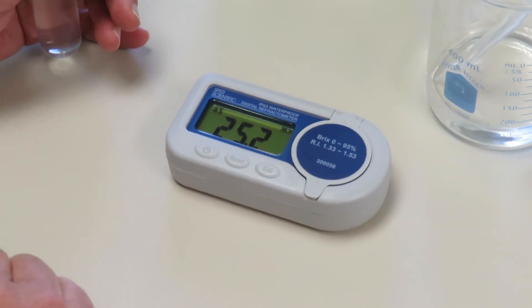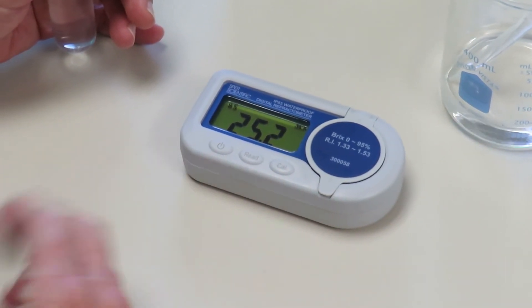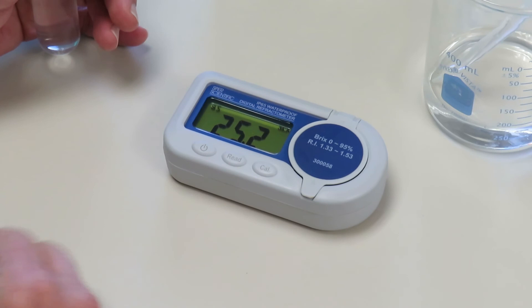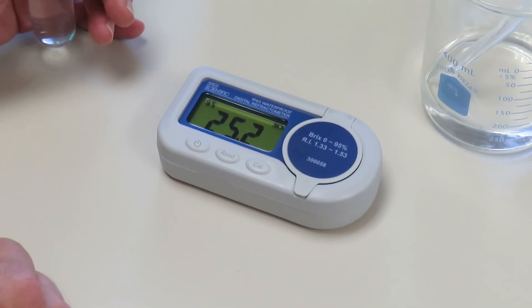and a nice, large, easy-to-read display. Very simple to use, as you've seen. And that's it for our digital refractometer waterproof series.